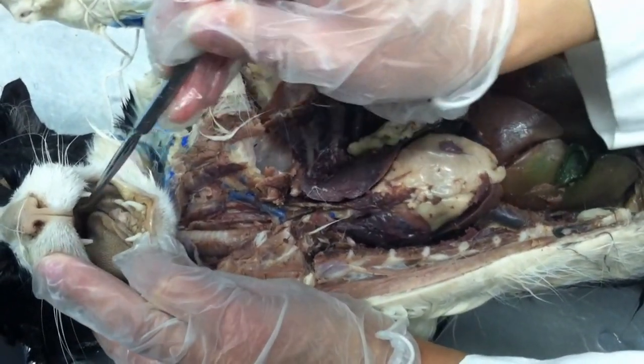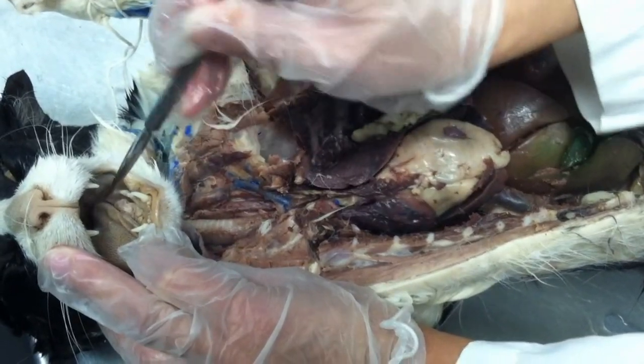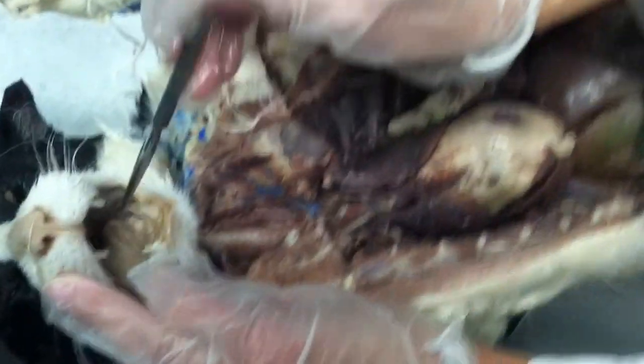Oh, so we still have the folds on top, here, but the back end of it is smooth, right? That's right. Hard and soft palate. So the hard palate has the folds. The soft is smooth. That's a difference.